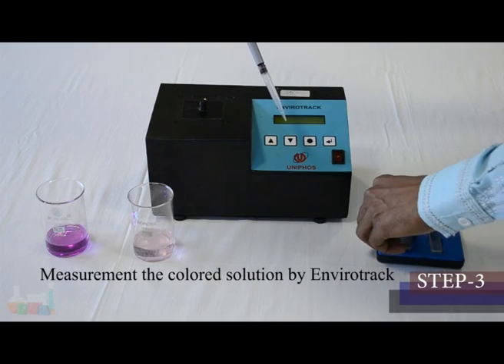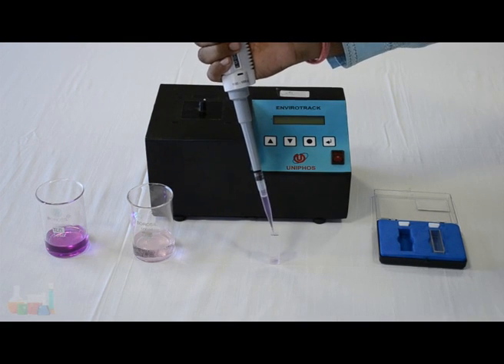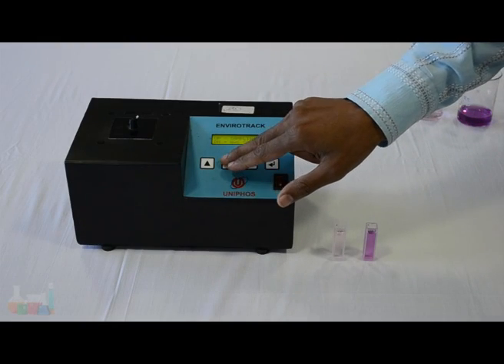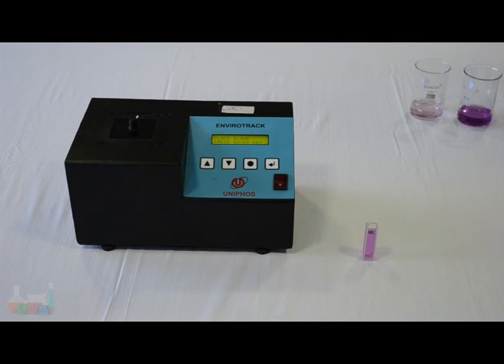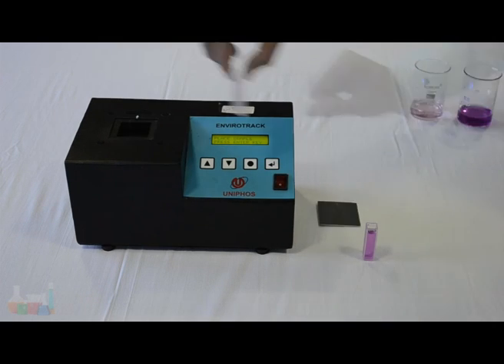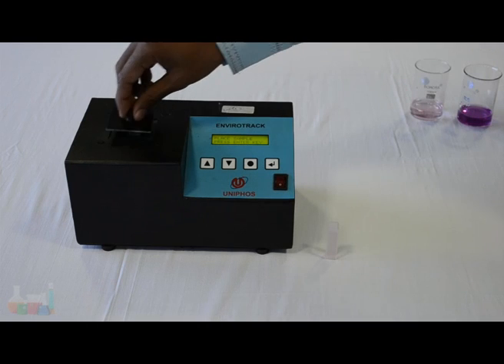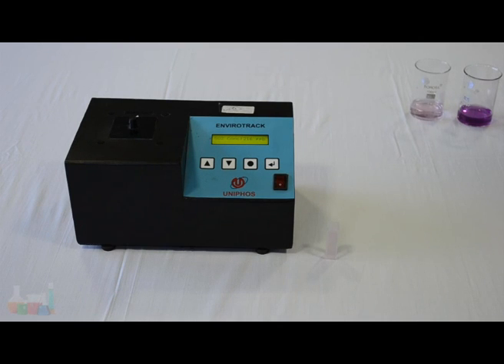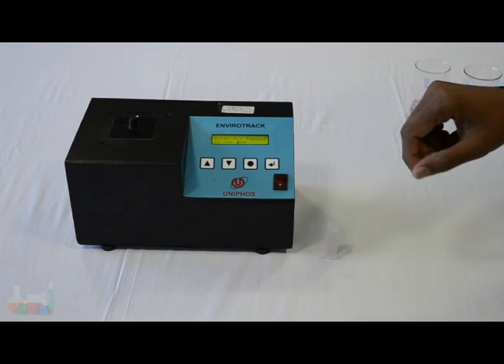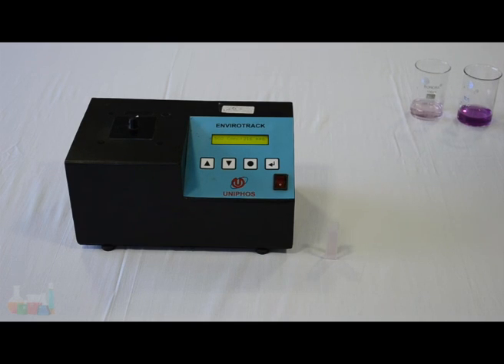Third step: measurement. Take 3 to 4 ml of the colored solution of the blank in a cuvette. Turn on the power of the EnviroTrack. Put the blank in the instrument and press the enter key. The instrument reads zero. Replace the blank solution with the sample solution and insert it into the sample holder. Press the enter key. The instrument prompts to specify the air sample volume. Specify the air sample volume read from the sampler and press the enter key. The EnviroTrack reads directly the TWA concentration for the chosen period of sampling.